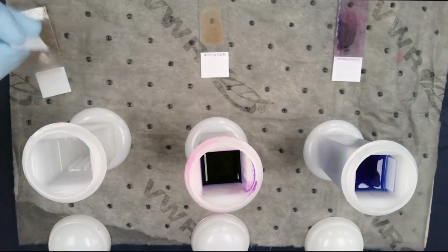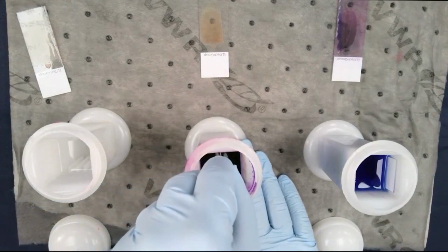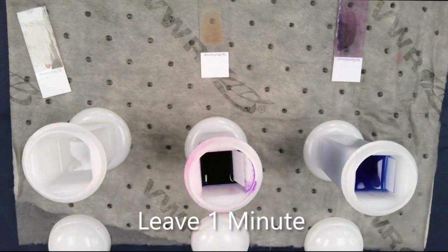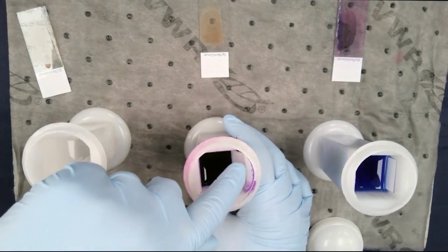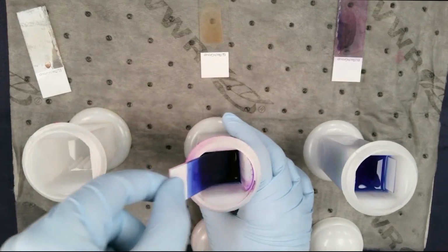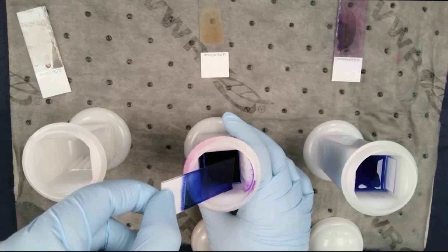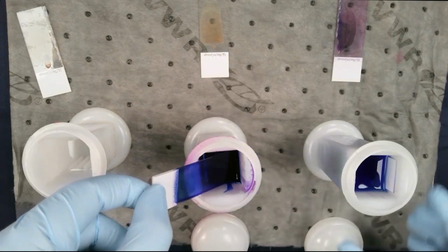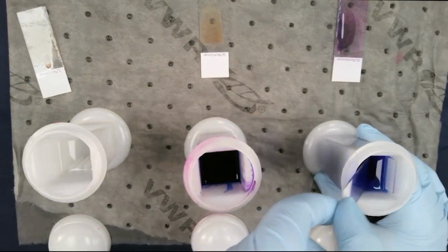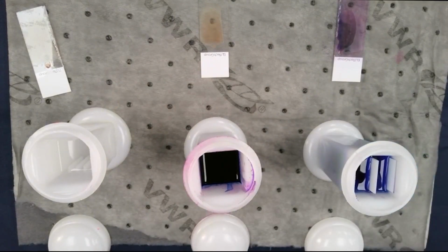Once that's finished, we're going to remove the slide and allow it to completely air dry. Then we're going to take our slide into the combined eosin thiazine solution and leave for 1 minute. Right now we are performing an example hand staining protocol with ELITech reagents, but other vendors' procedures and timings may be different. After staining, we're going to allow that stain to drain off as much as possible to prevent carryover, and then we're going to transfer the slide into our buffer reagent for rinsing. The buffer reagent is normally colorless, but is quickly colored bluish when rinsing the stain off and should be replaced after every couple of stain procedures.